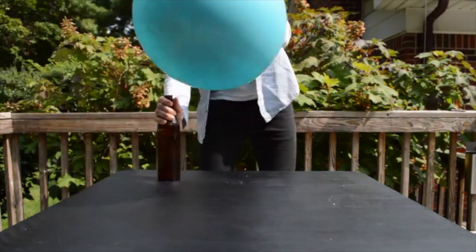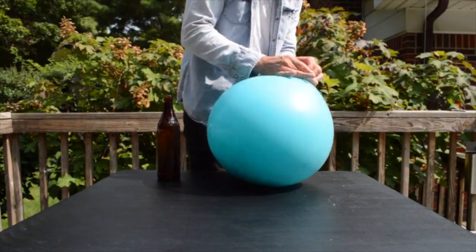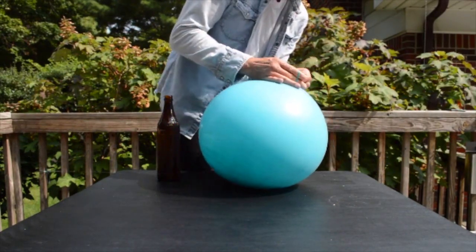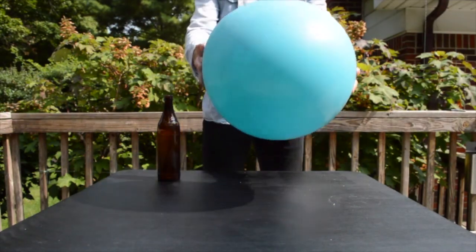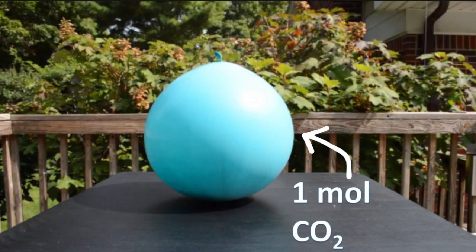Once the bubbling stops, carefully tie the balloon so that you don't lose any CO2. There we go. That's a whole mole of CO2 gas.